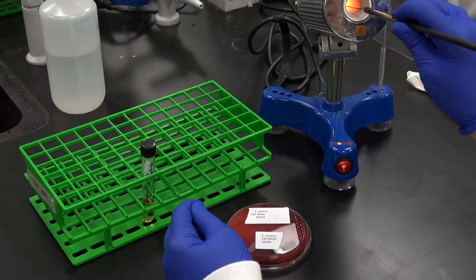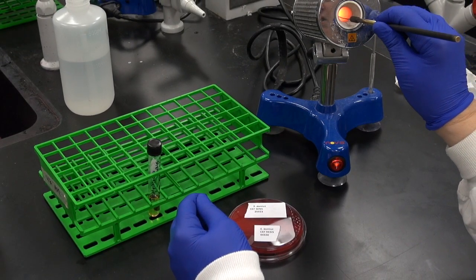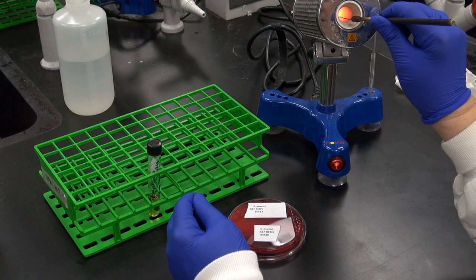Then incinerate the loop to sterilize it, heating it slowly to prevent any spatter from the liquid that remains on the loop.